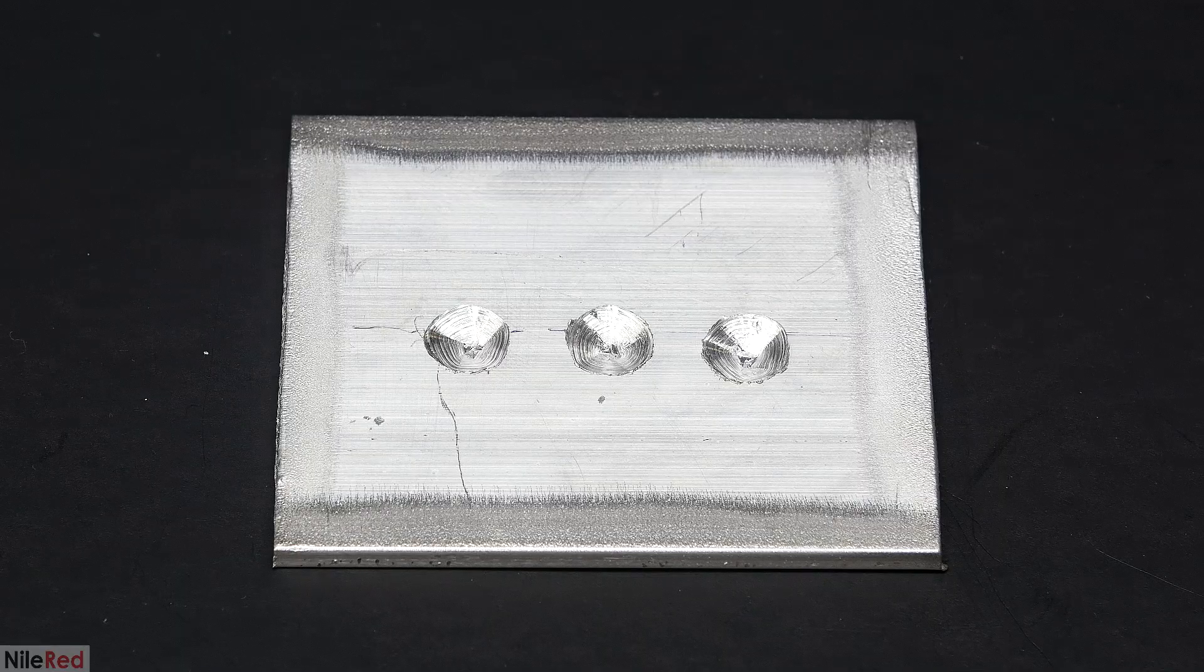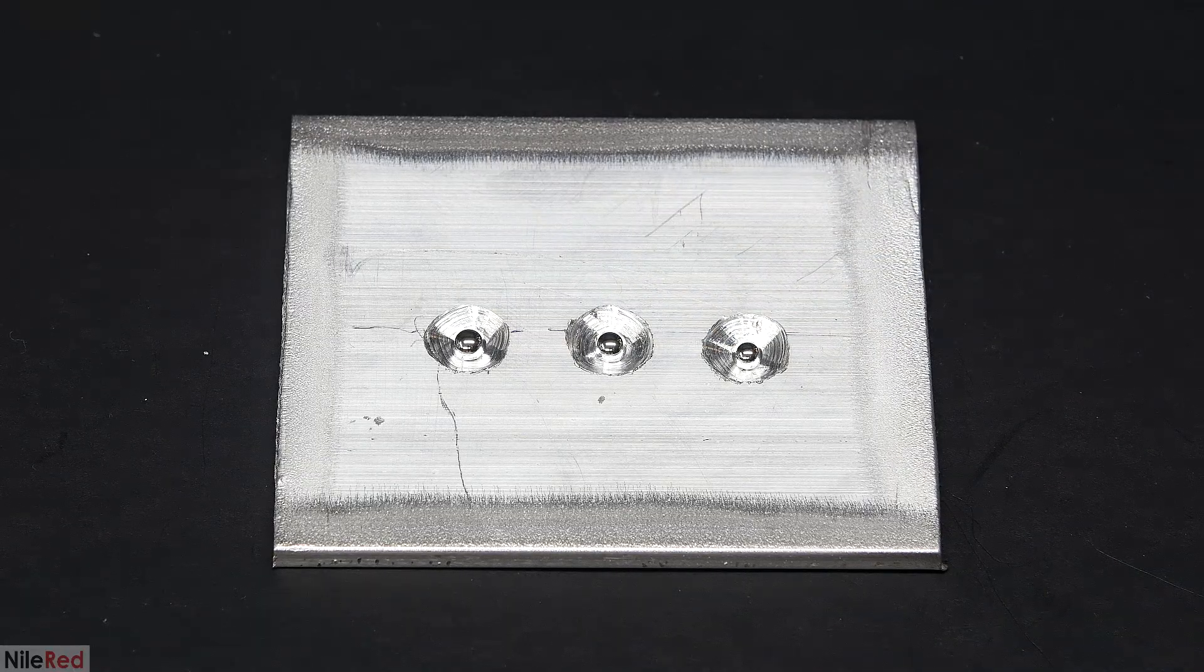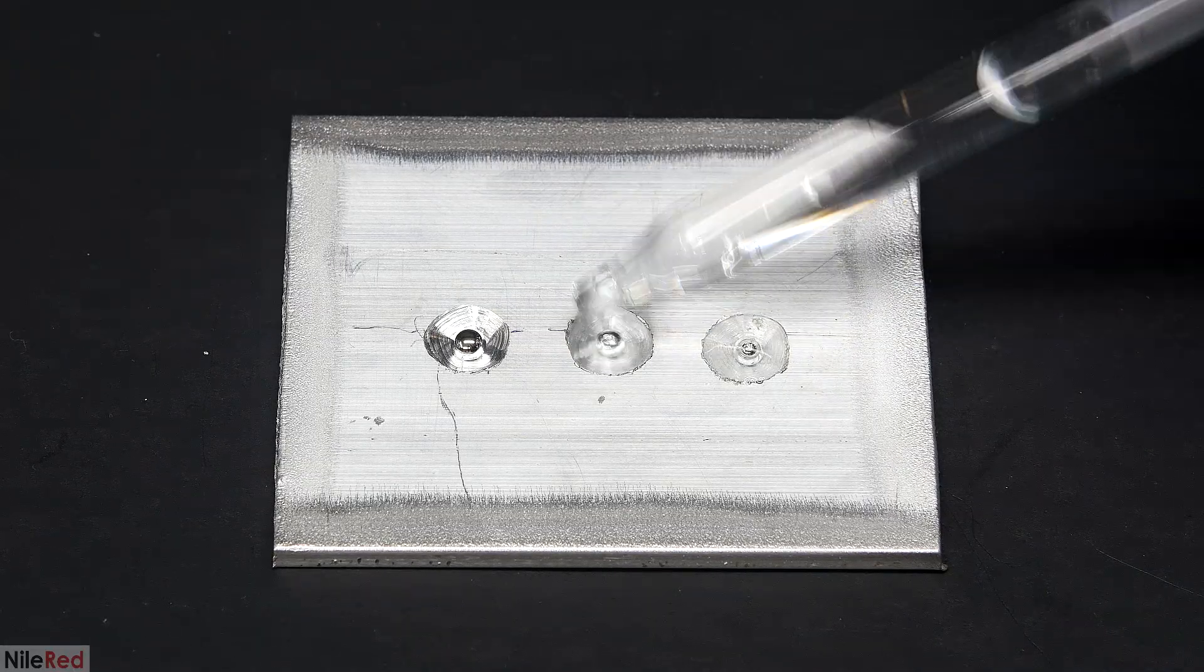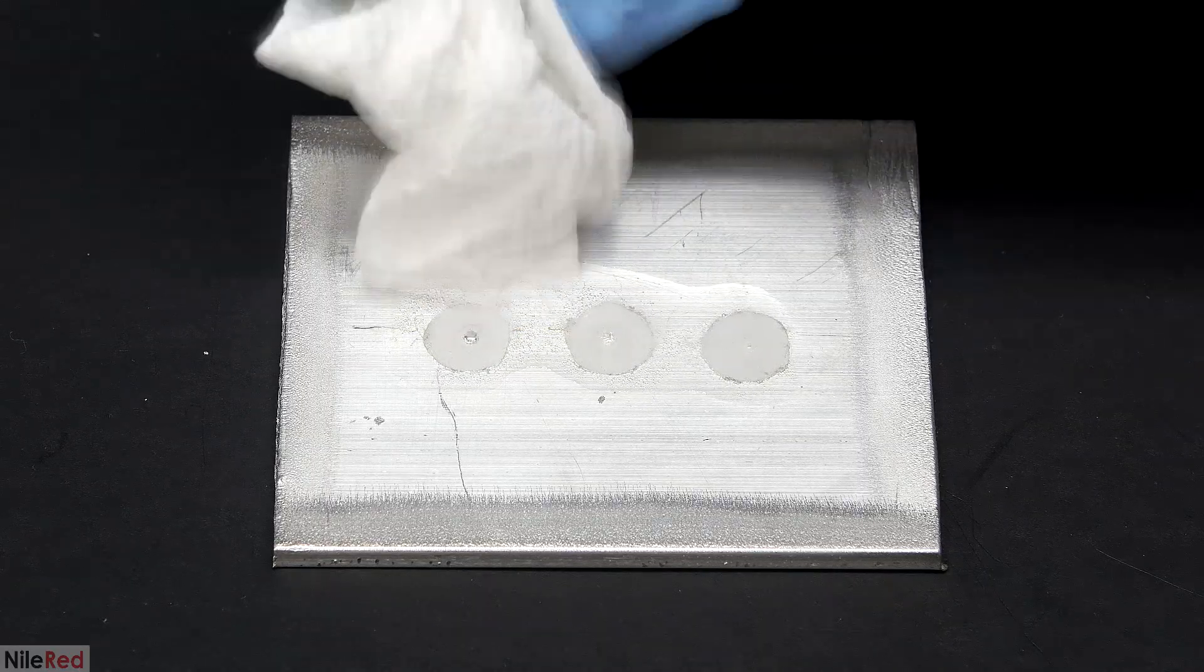Now for the last test, what would happen if I did it in a few spots at the same time and had the towers overlap? Well, honestly, it's not too interesting, but I figured I'd include the footage anyway.